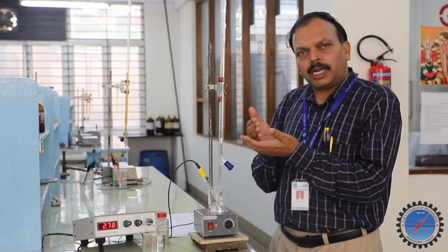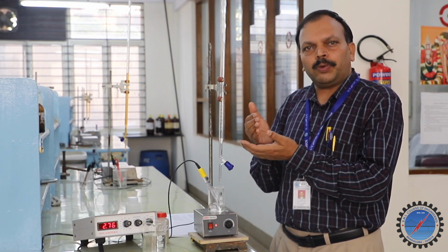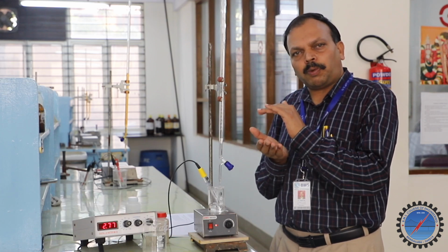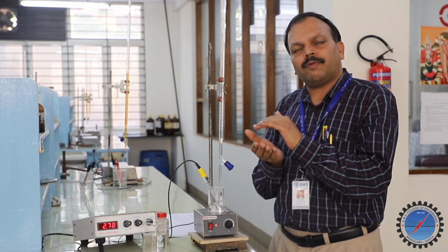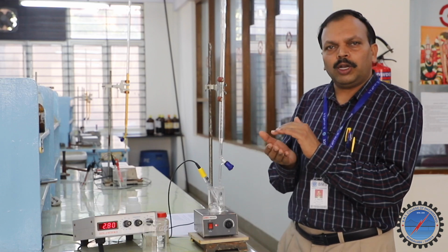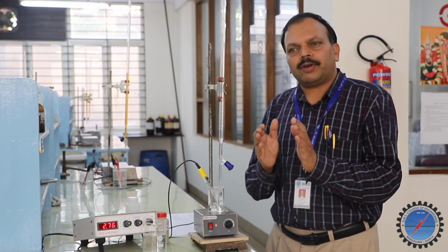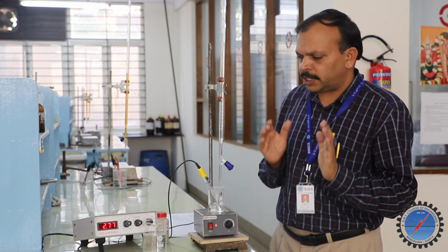Once we get the delta pH value for the corresponding volume, like 0.5, 1, 1.5, 2, 2.5, and delta V becomes the fixed value of 0.5 ml, we are going to take the ratio delta pH by delta V for all the delta volumes of NaOH added. That we are going to record in the graph. Later we will show you how we are going to plot the graph on this calculated basis.